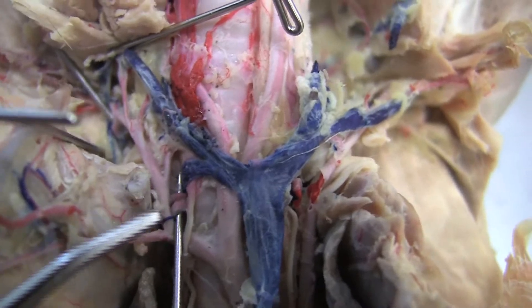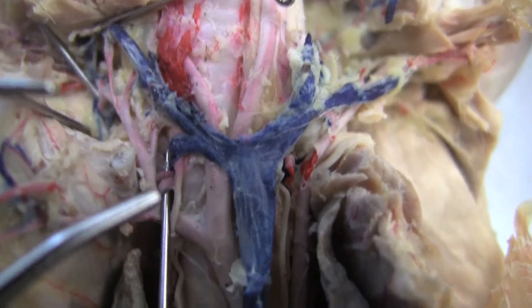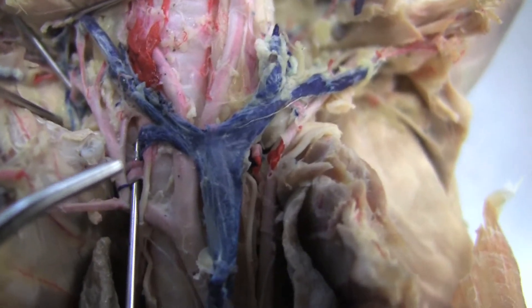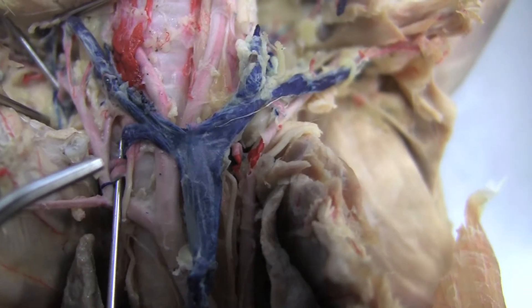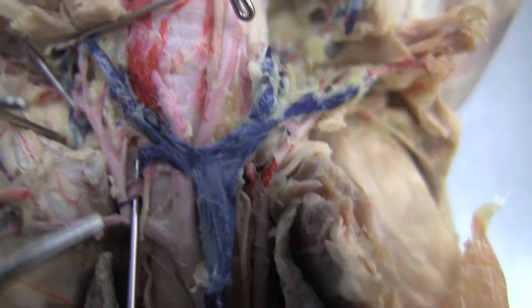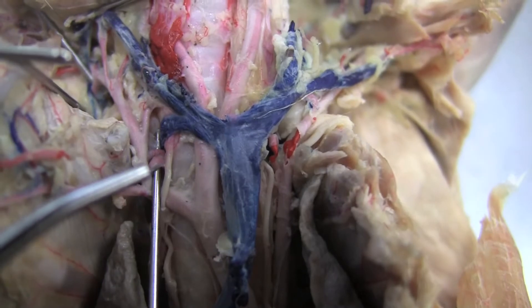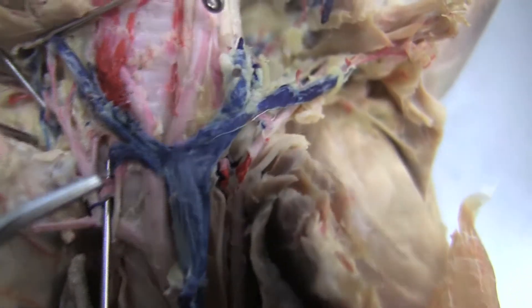Here's the brachiocephalic again. This first one will be the vertebral, second — costocervical. So you've got your internal mammary, vertebral, and costocervical.